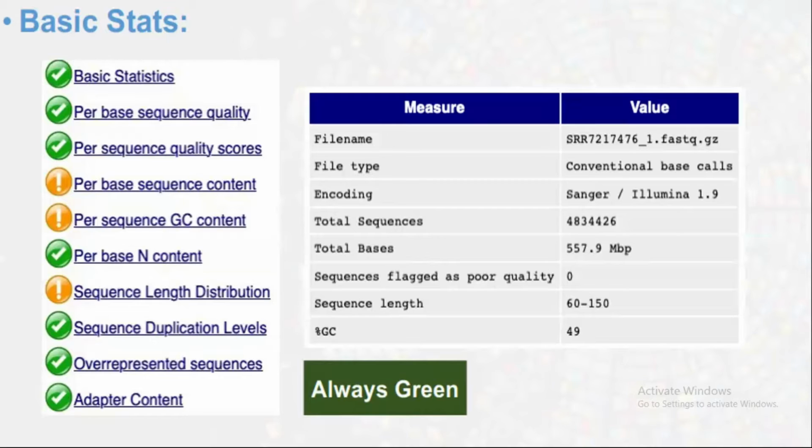Now the total bases are 557.9 million base pairs, and the bases are basically adenine, guanine, cytosine, and thymine. After that, the sequences flagged as poor quality. Basically, it does not have any poor quality. When you are dealing with raw data, it should contain some poor quality, or if it was already pre-processed by the company, then there will be no poor quality. So basically it shows the poor quality.